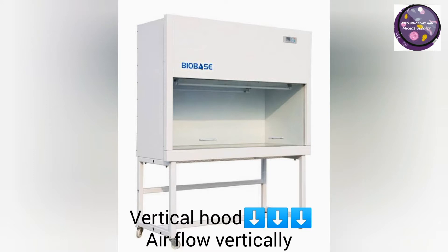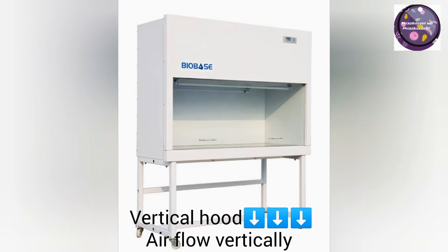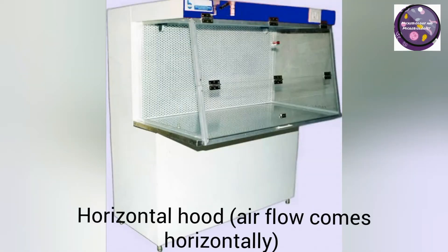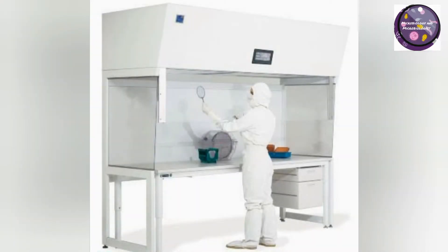There are two kinds of hoods available in the market: vertical and horizontal. But both have the same functions.